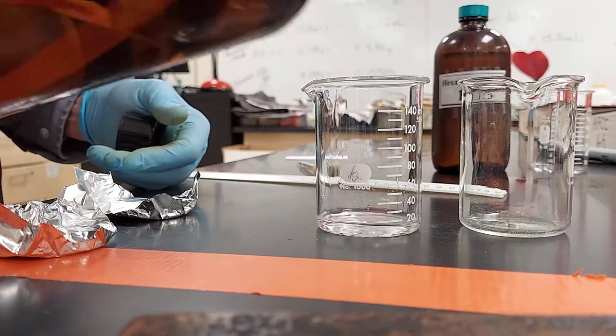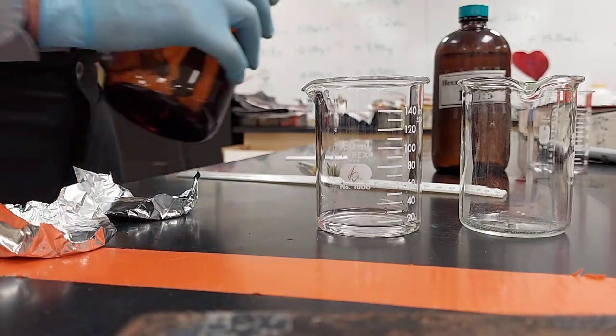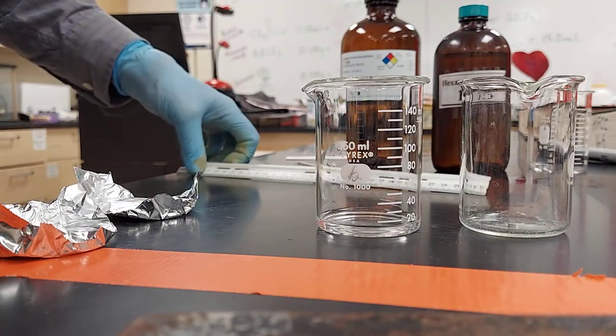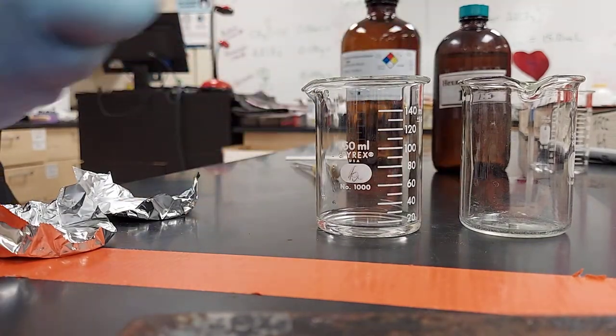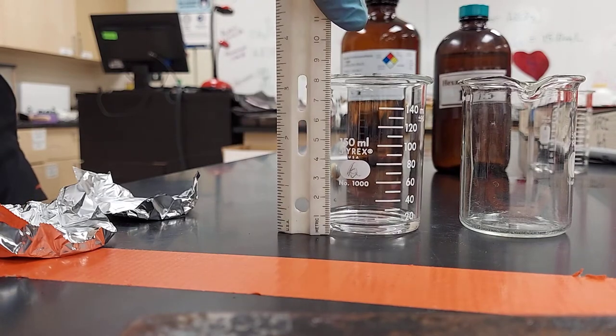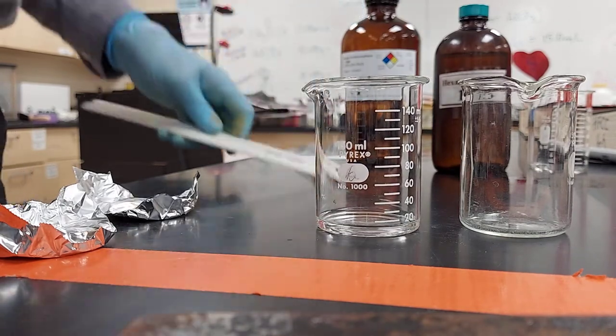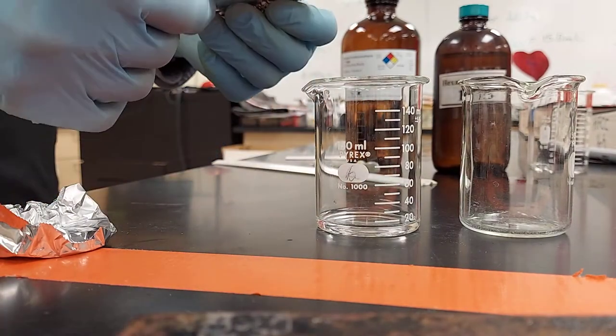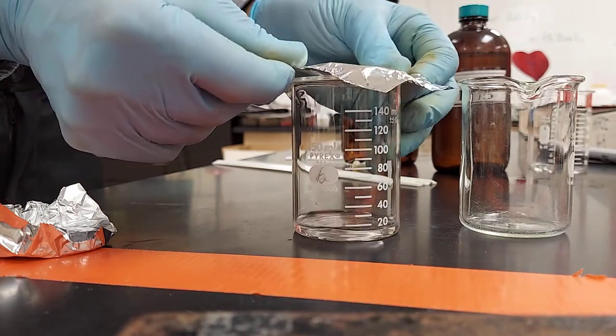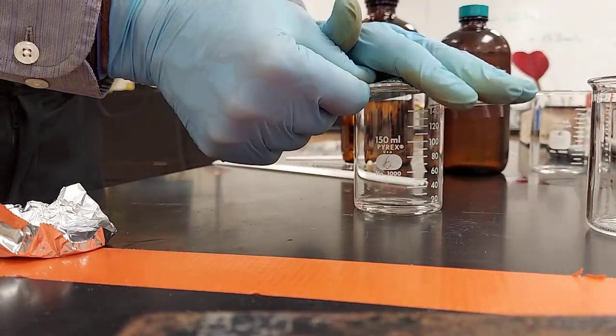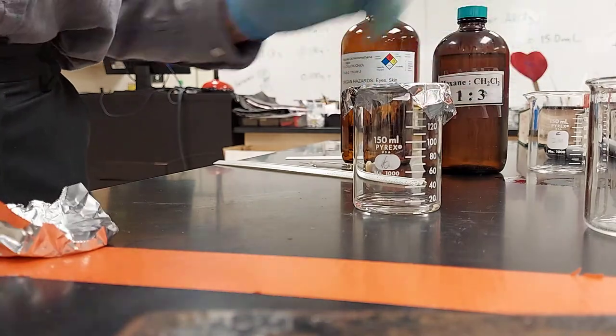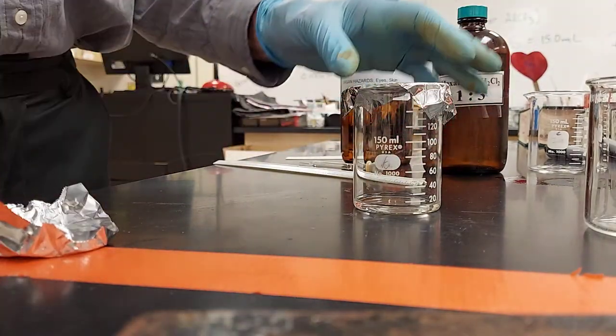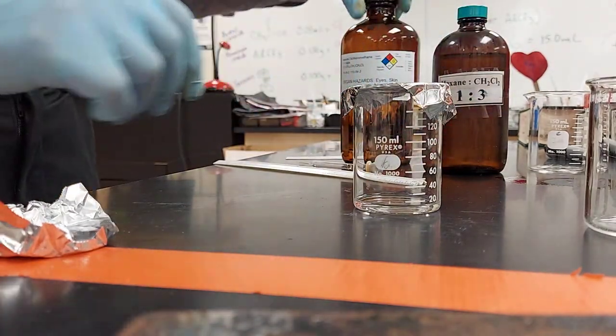You need to pour less than a centimeter of liquid. You don't have to measure it, although here it is, and it's less than a centimeter. Then you immediately put the cover on it, press firm with your palm, make sure it's sealed. So that's the one-to-one.